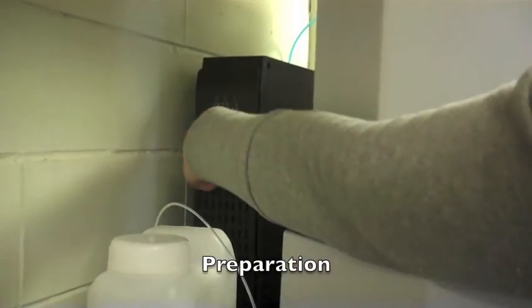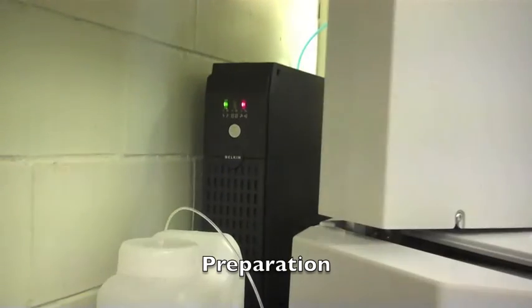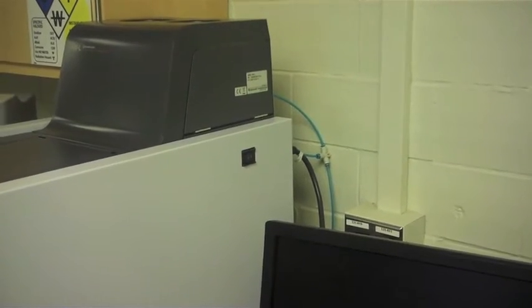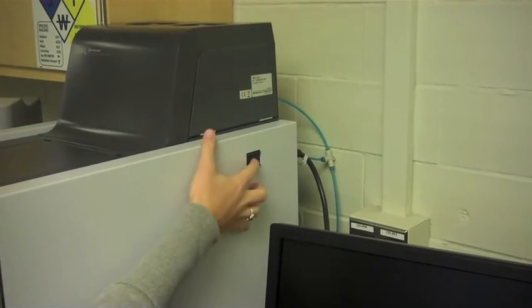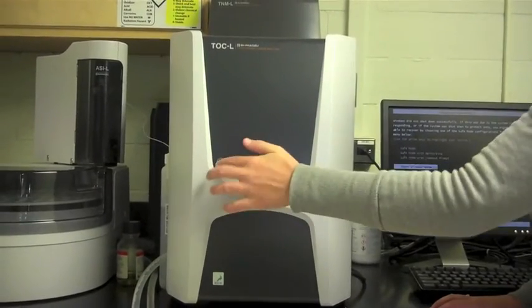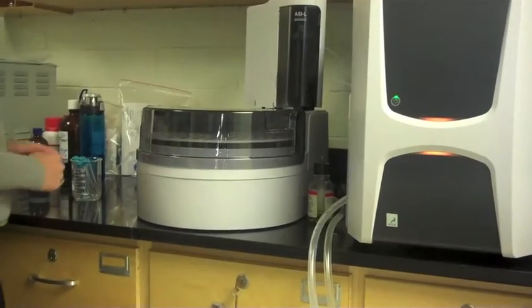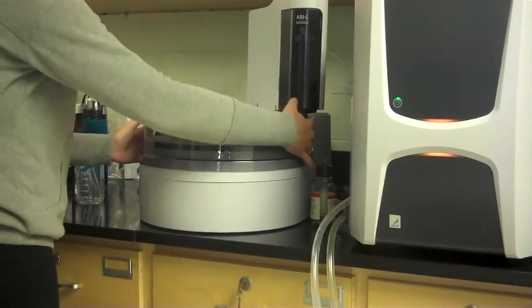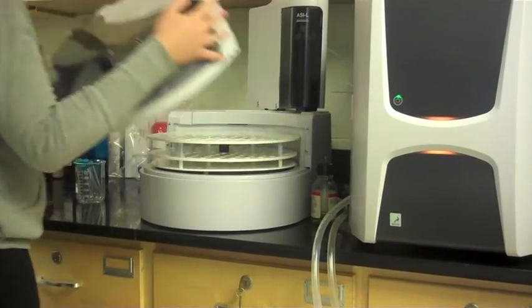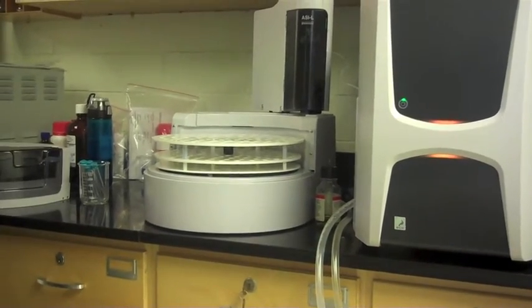First, one must turn on the power unit for the whole apparatus. Following, the computer and the TOCL unit should be turned on. In order to load test tubes into the machine, one must first remove the ASI cover, which slides off.